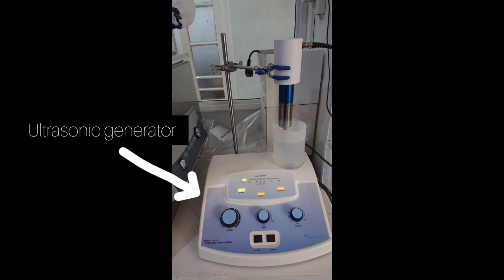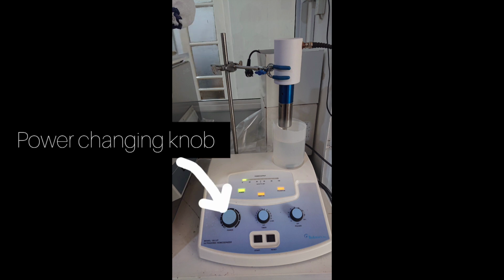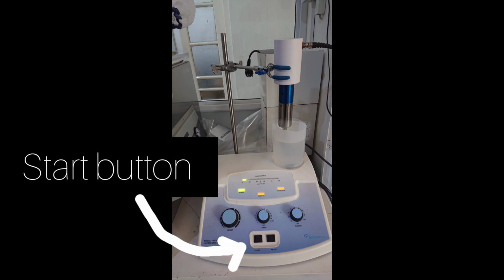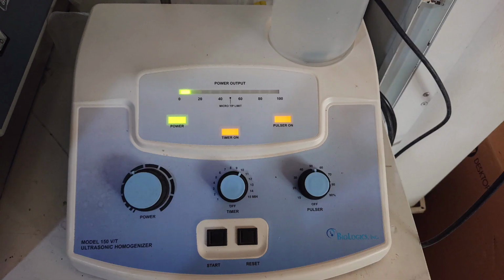Now let's jump right in. What is an ultrasonic homogenizer? An ultrasonic homogenizer is a powerful laboratory instrument used to break down and homogenize various types of samples. It utilizes high-frequency sound waves to disrupt and disperse particles, creating a uniform mixture. This technology is widely used in research fields such as biotechnology, pharmaceuticals, food science, and more.